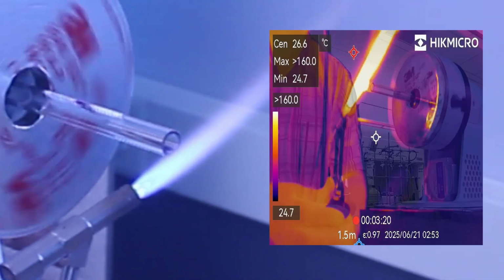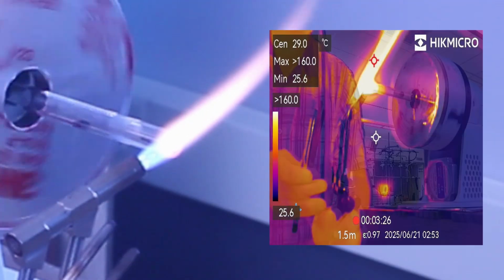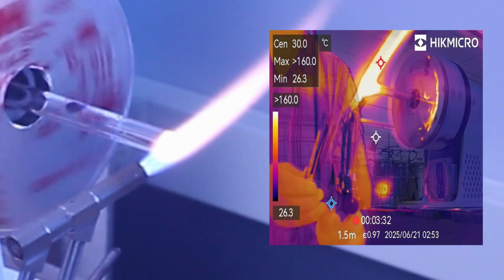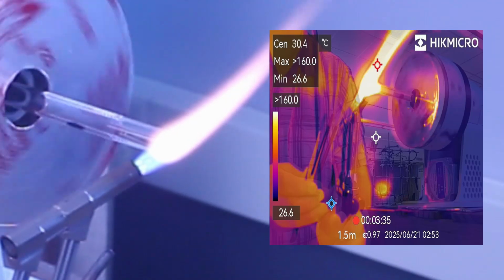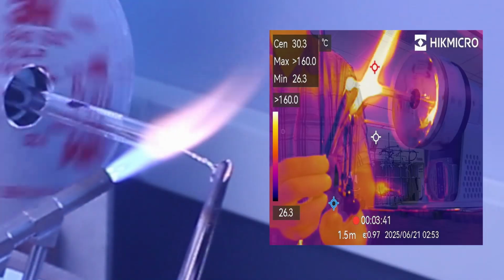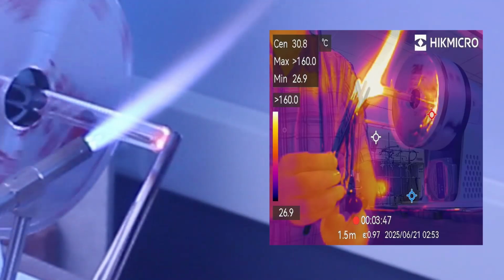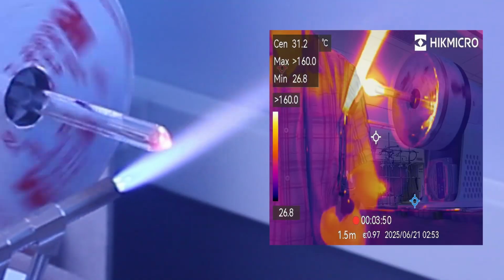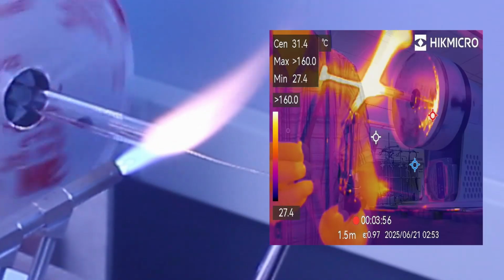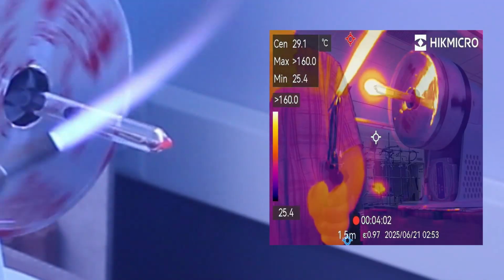I'm going to actually sharpen it just a little bit. Pinch and then pull and burn that off. And if you're not happy with the end, you can just repeat the process to get a nice, clean, even point. There we go. At this point, I have a test tube, but it's not very good looking.